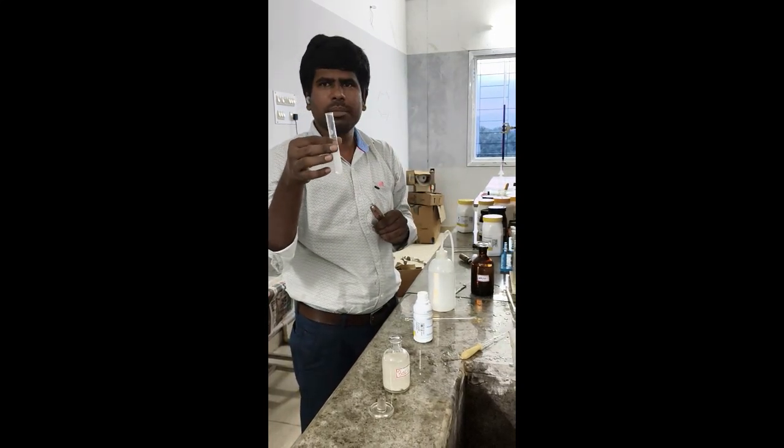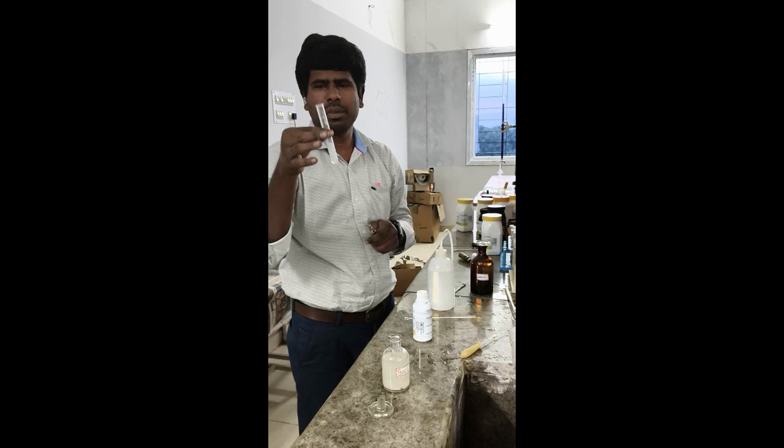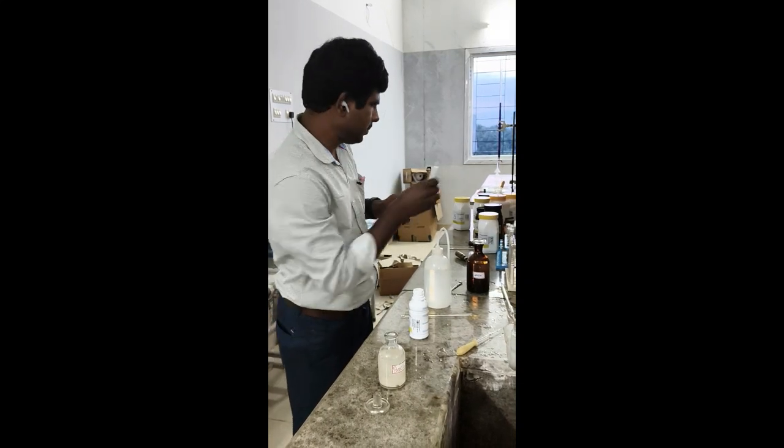So we have ammonium cation and sulfate anion. So the salt is ammonium sulfate.